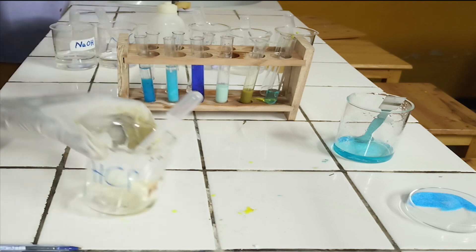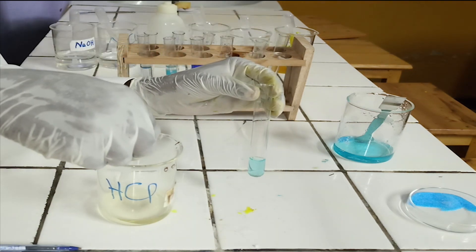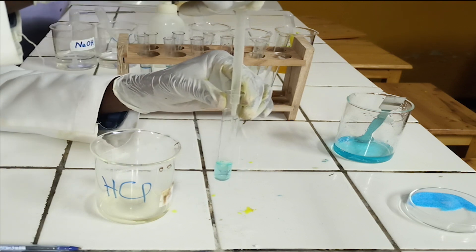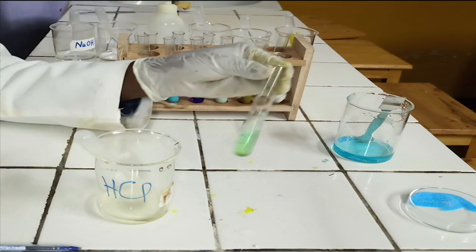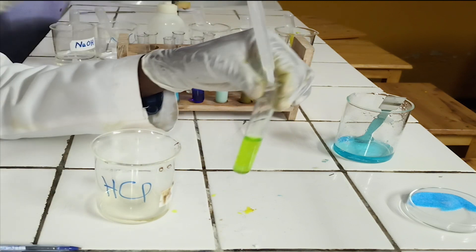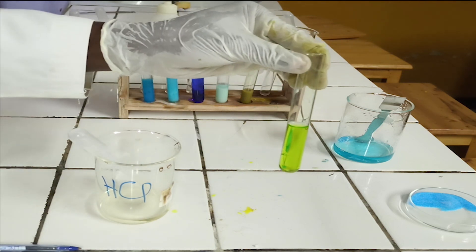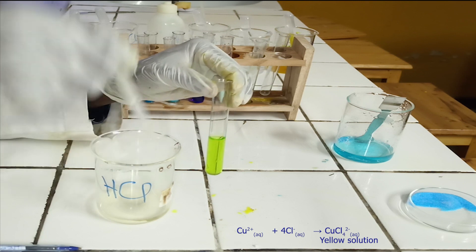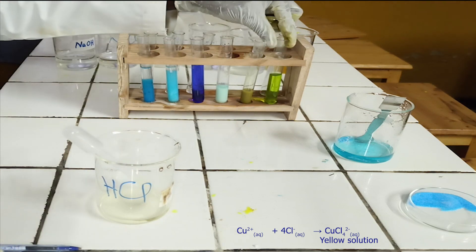Fourth confirmatory test. To the sixth test tube, add excess of concentrated hydrochloric acid. As you see, concentrated hydrochloric acid reacts with copper-2-ion to form a yellow solution. Below, there is the ionic equation for this reaction.